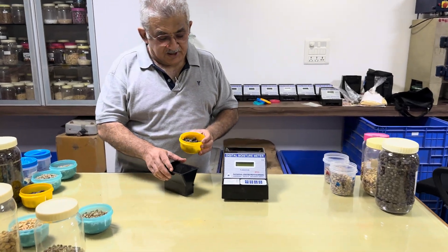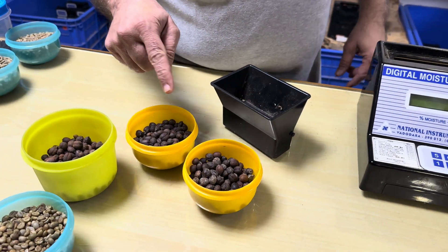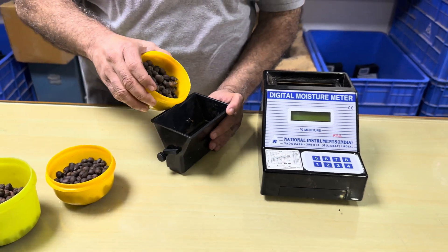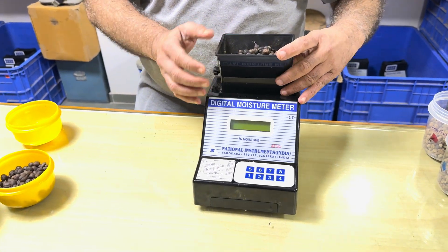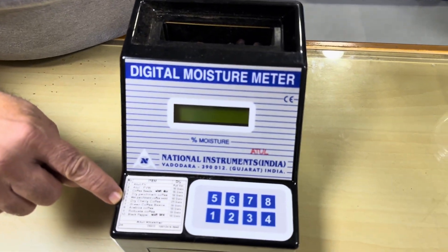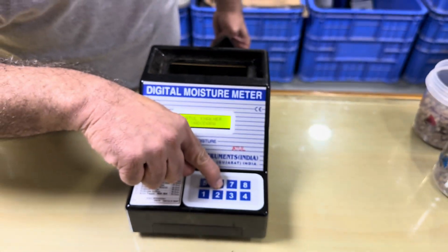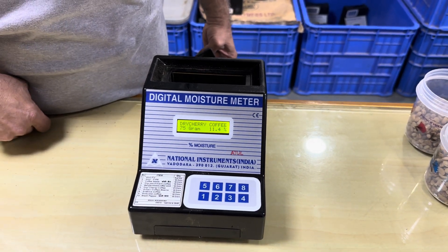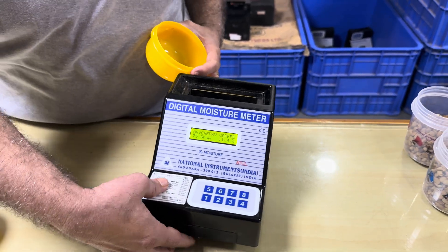We have 3 samples of dry cherry. I will show you how we can measure it. I will pour one sample — this is 75 grams of coffee dry cherry. On channel 6 you can see 75 grams is the specified amount. If I press the number 6 key, it will indicate the moisture contained in dry cherry. This shows 11.4% moisture.